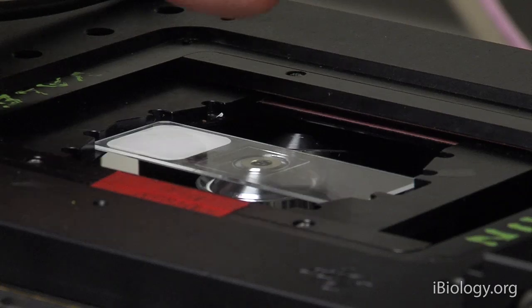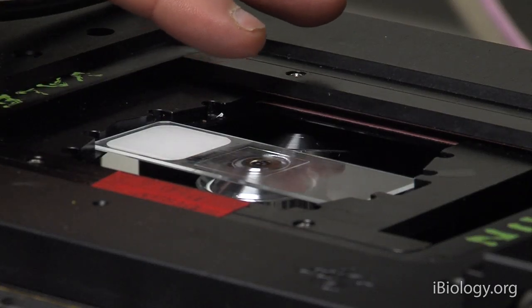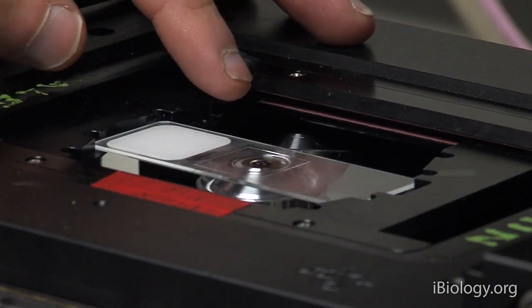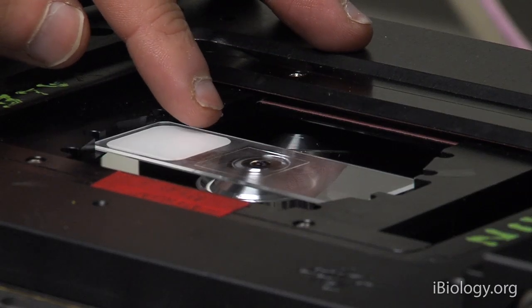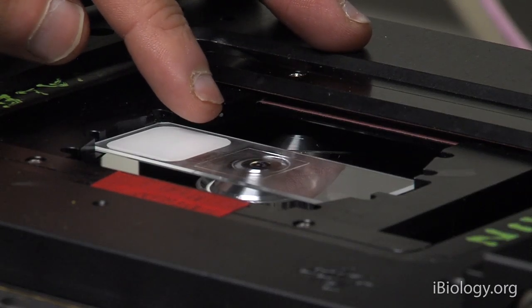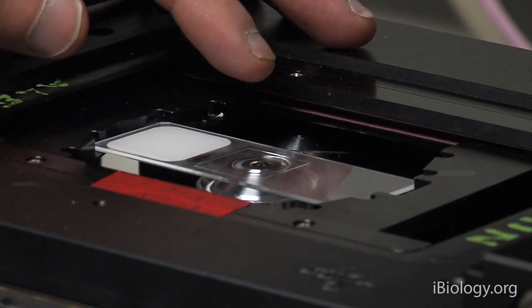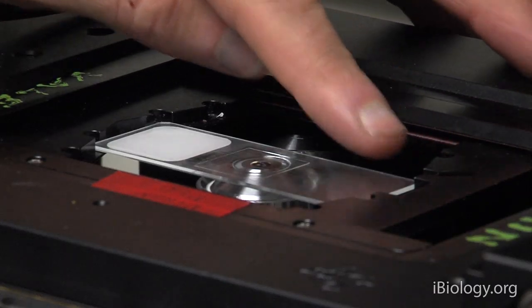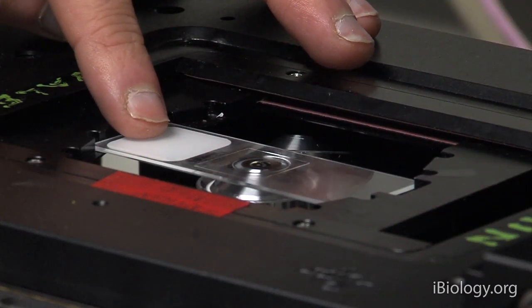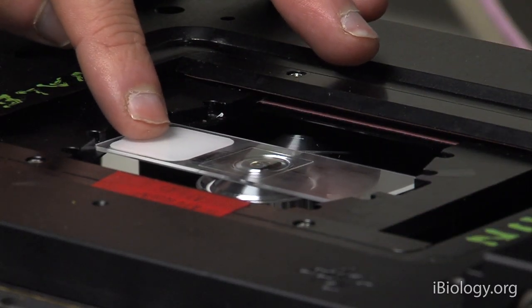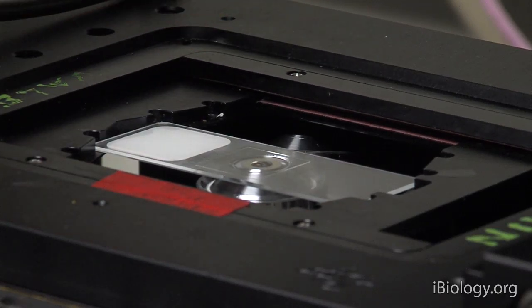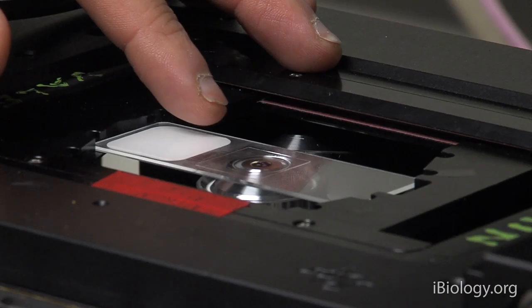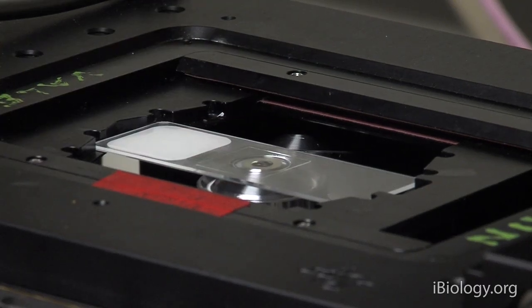Now, this can be potentially damaging to your objective lens, and there are a couple ways that you can protect against this. First of all, if you know you have a difficult sample to focus, you may not want to clamp it down rigidly onto the stage, but keep it loose, so if you go overfocus, it's just lightly lifting the slide and coverslip.